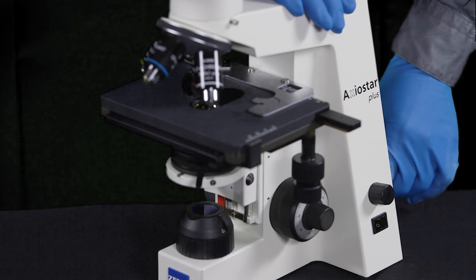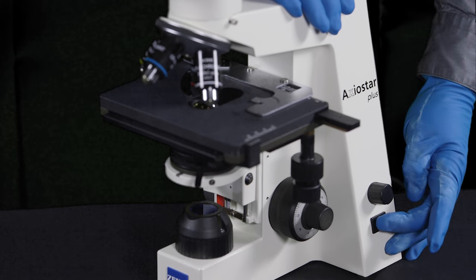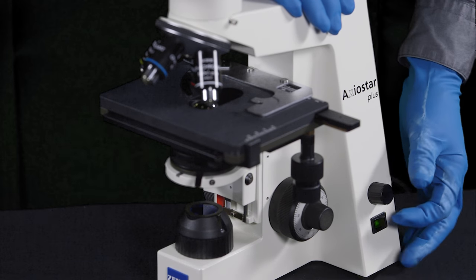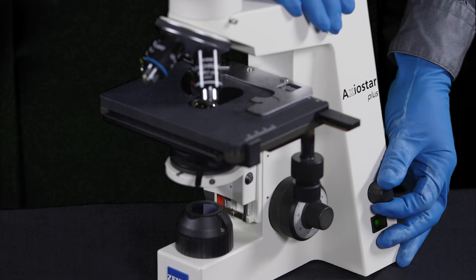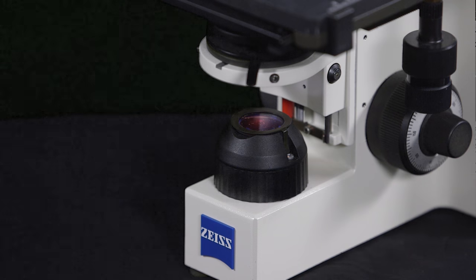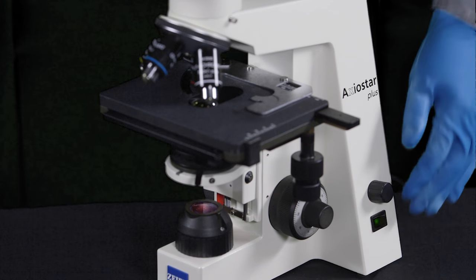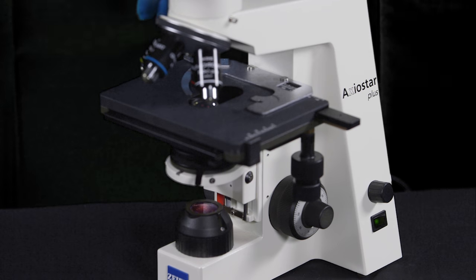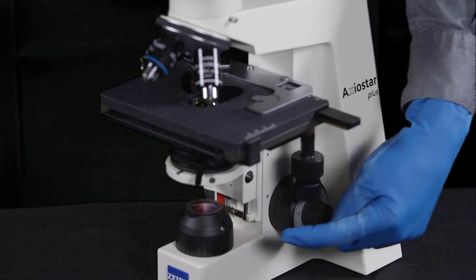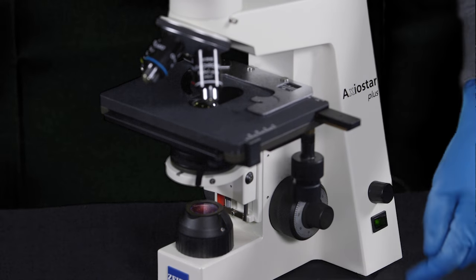The first thing you need to do is plug in the microscope and turn on the illuminator, then use the rheostat to raise the level of the light. You should start with that open halfway. This will give you light from the illuminator up into the condenser and to your specimen.